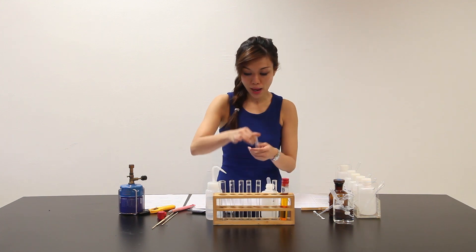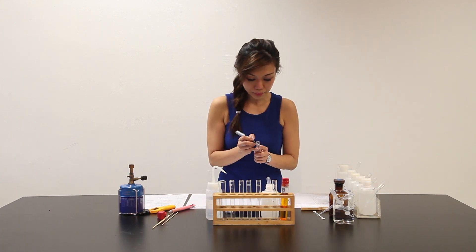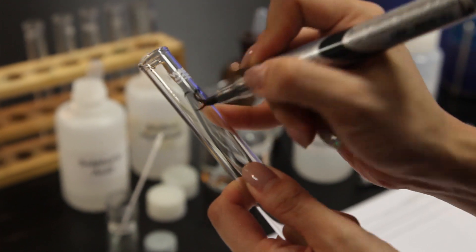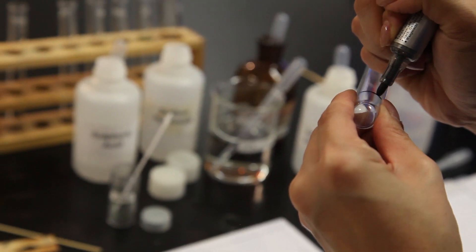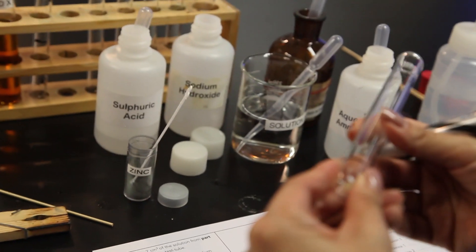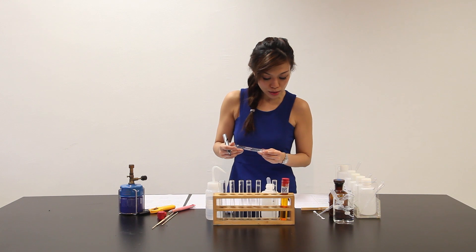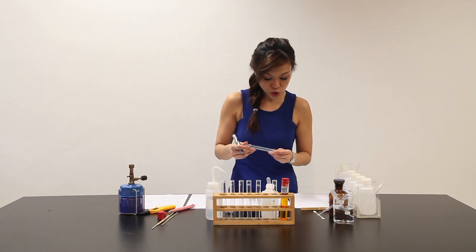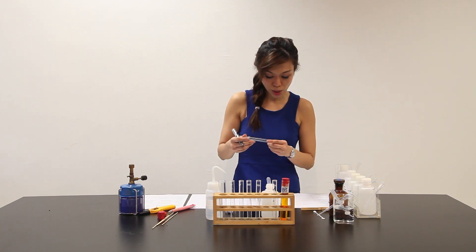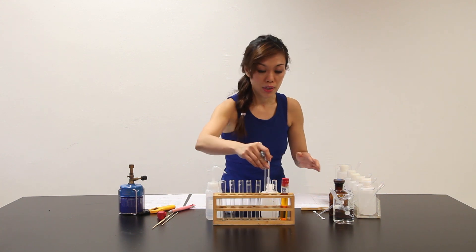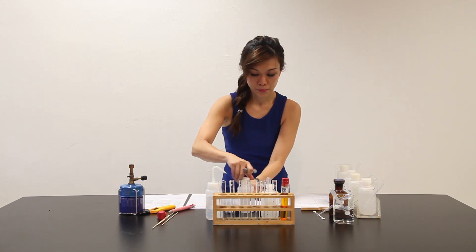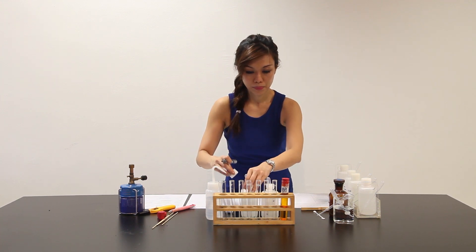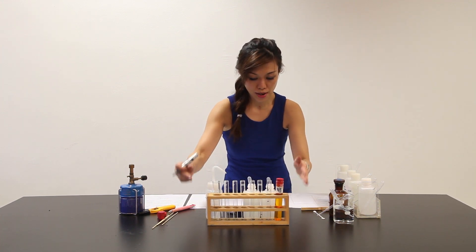Well, let's move on to part C. Part C now. Let me label the test tube. Part C here says place about 2 cm³ of part A in a clean test tube. And to this test tube, add dilute sodium hydroxide solution drop wise with shaking until no further change is observed. So, let me use sodium hydroxide right in front here.